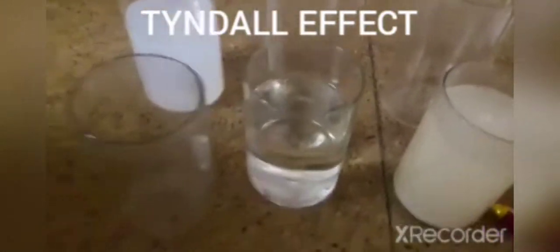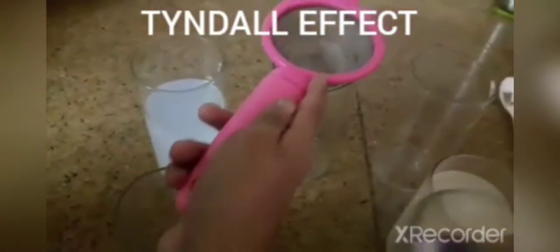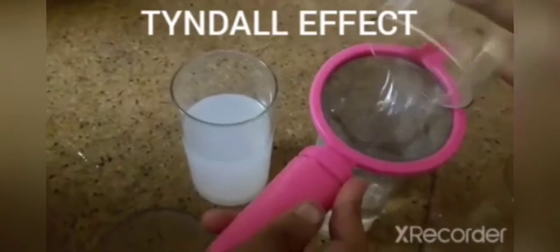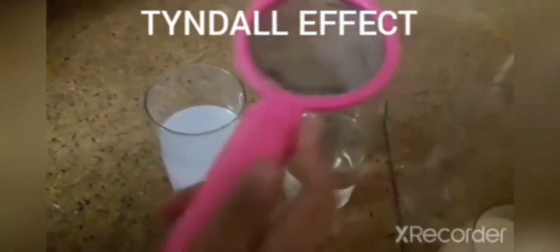So we'll mark a no. And next one is for a true solution. Therefore, again, there is no residue left. So a no for sugar in water.